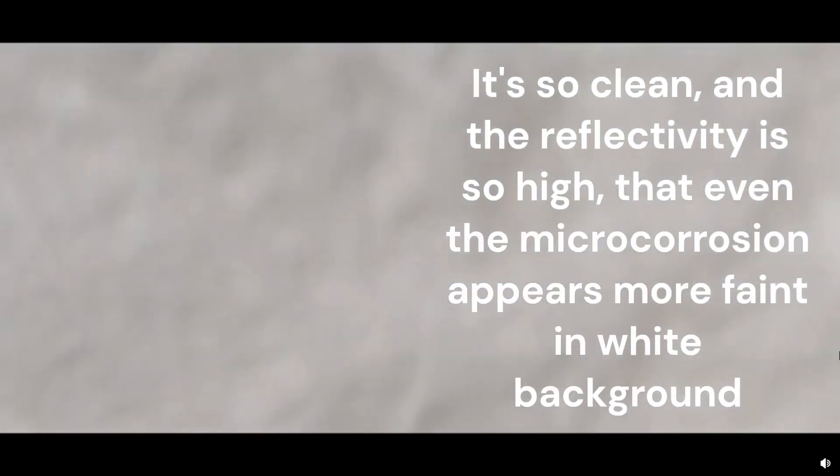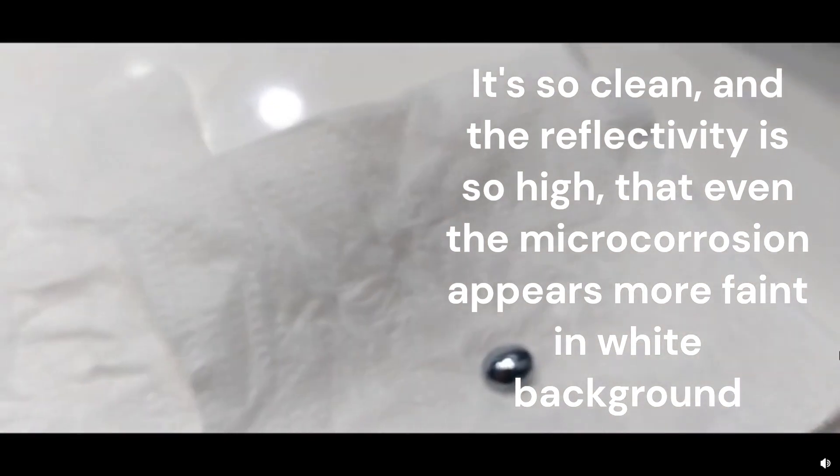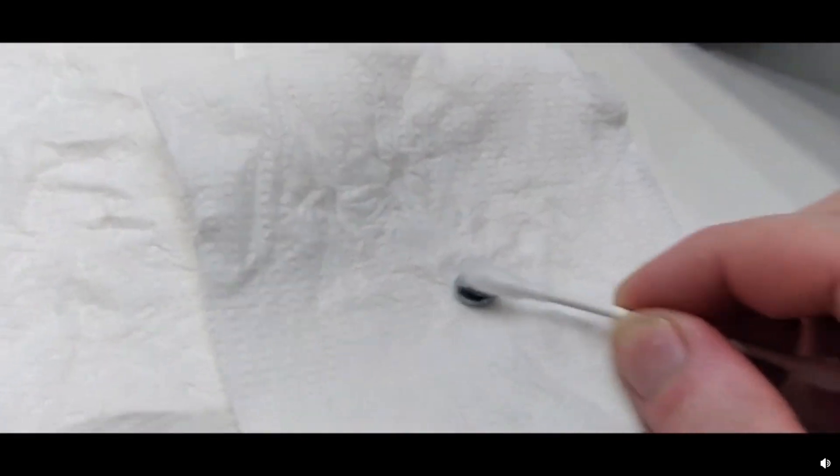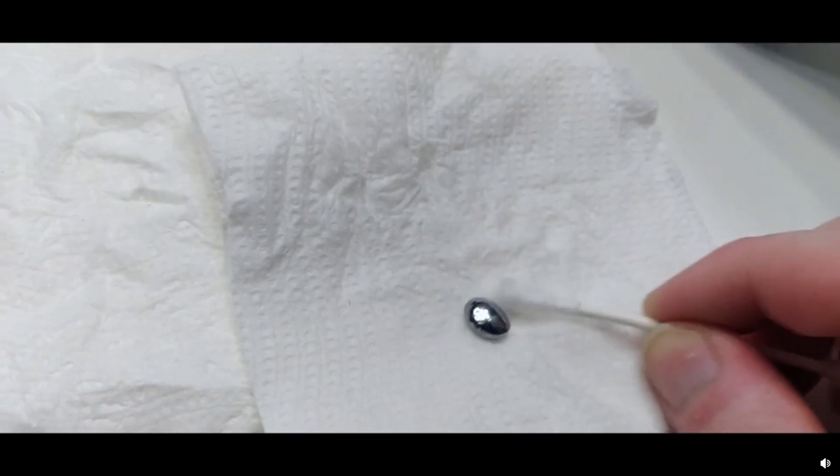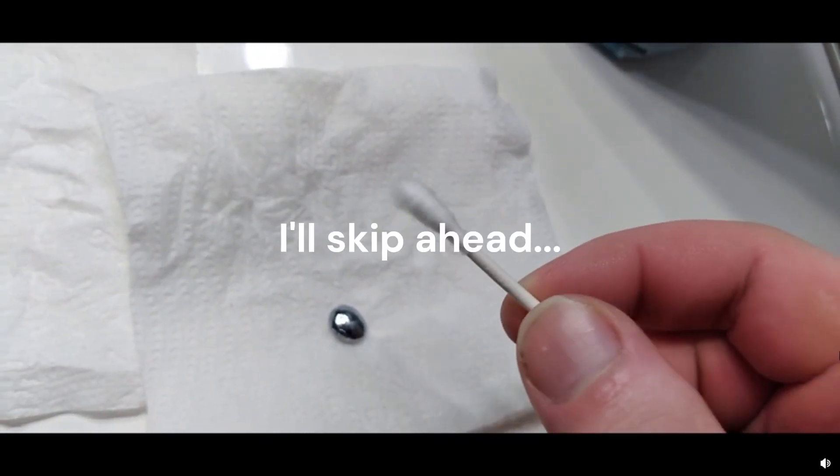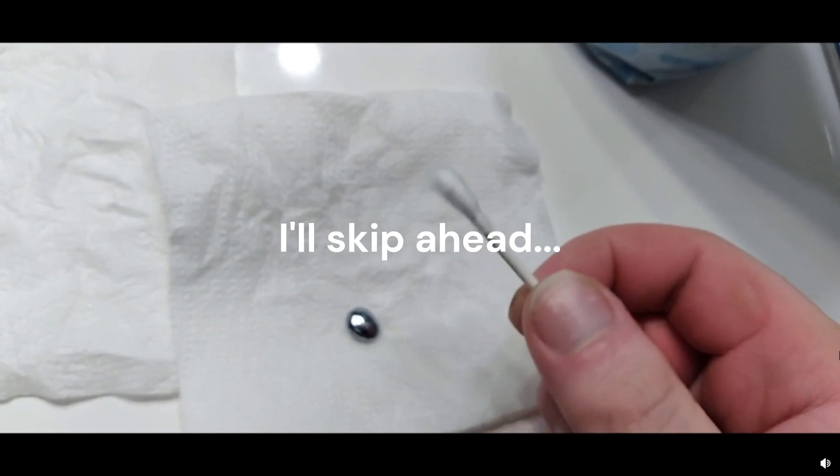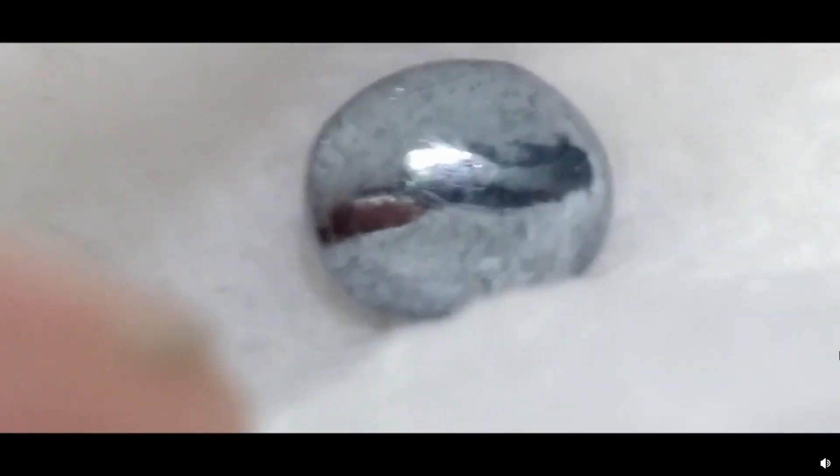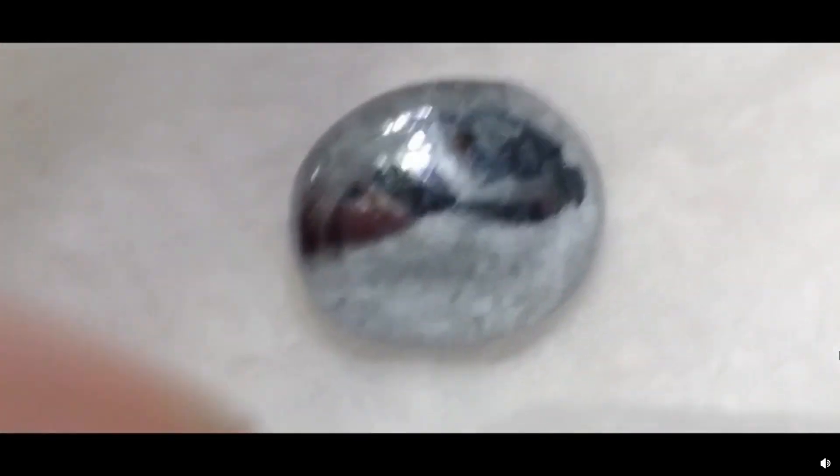Now I did the test with, I did this test and you know, nothing's happening. I don't know if Osmium tetroxide reacts with cotton. It's a strong oxidizer. Yeah, it just looks like it may have taken off the staining from the permanganate solution. And maybe that's all it was. Maybe it didn't even oxidize. Maybe it just stained the Osmium a bit and the Piranha solution took it right off. And maybe it took off some of the tarnish as well, which is honestly surprising.